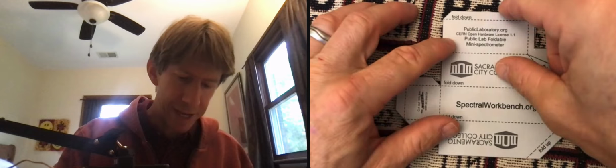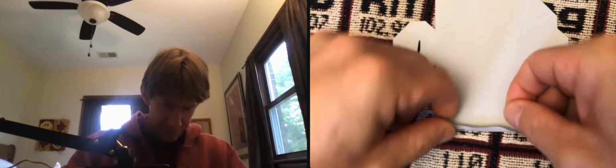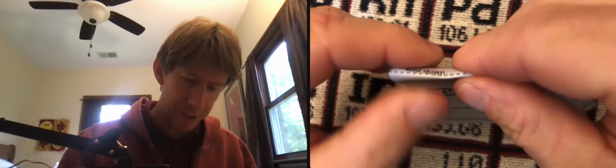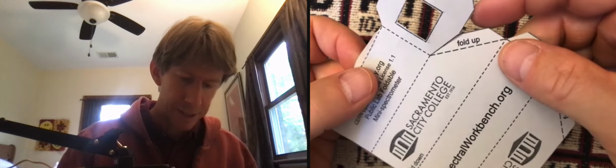And let's see, so where it says fold down, I'm gonna fold it down, which way is down is away from you. And again, I'm gonna do it as close as possible to this line. I know this is cardstock, so it's a little hard to bend, but the cardstock actually is a thicker paper that will make it a better spectrometer and it'll make it block light better. So I folded that one down. Not gonna fold that. Oh, that one's a fold down. This one's a fold up.